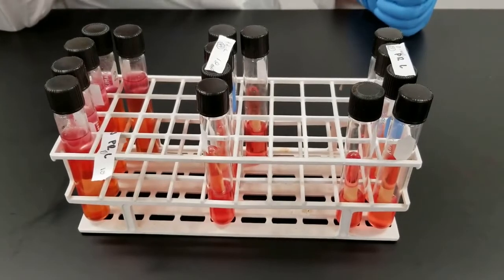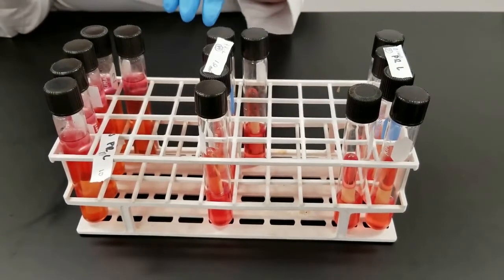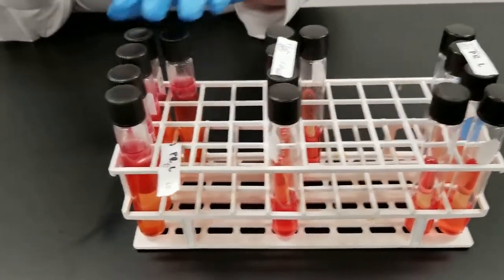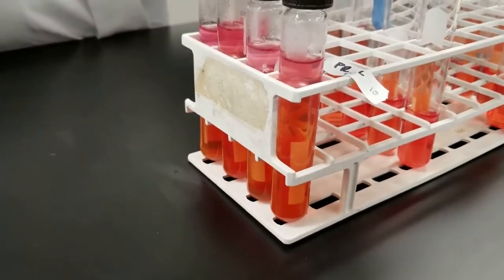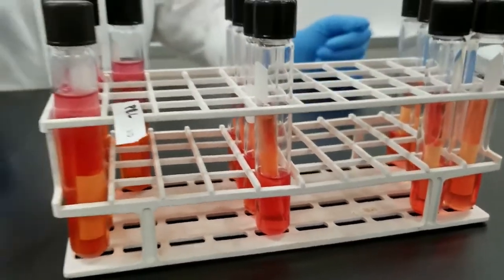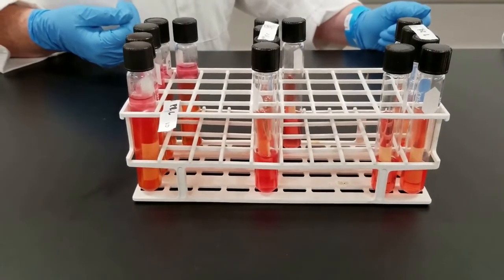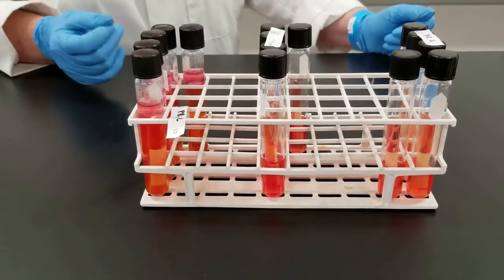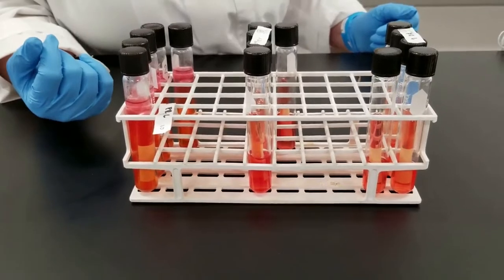In this process, we had 5 tubes at different concentrations that we added our water sample to. This was a double strength phenol red lactose. All these are lactose. In this first one, we added 10 mils of the sample, then 1 mil, and then 0.1 mil. You have the phenol red pH indicator. If acid is produced, it would turn yellow. That is what you would be looking for as a positive result. You also have the inverted Durham tubes to collect gas if gas was also produced.